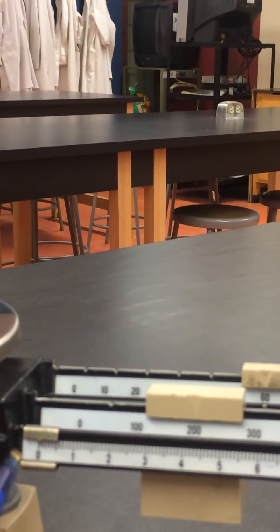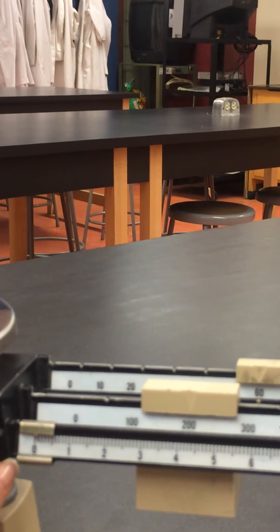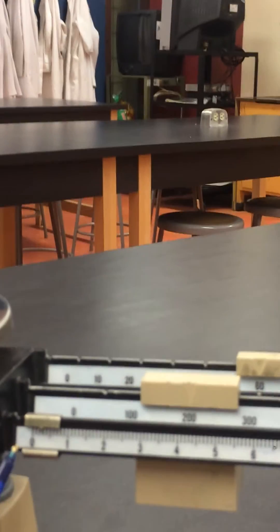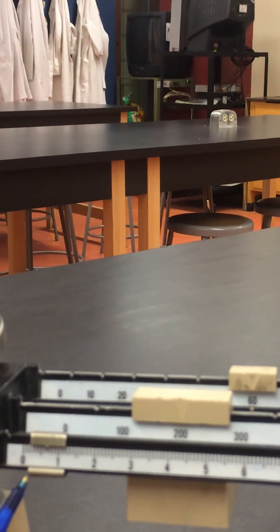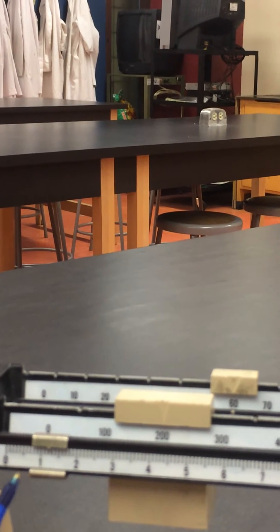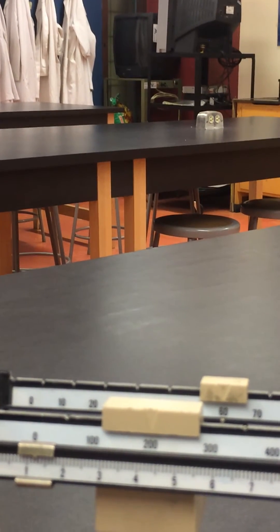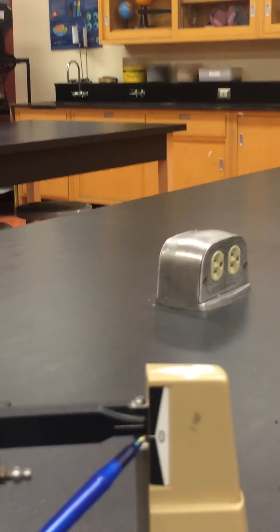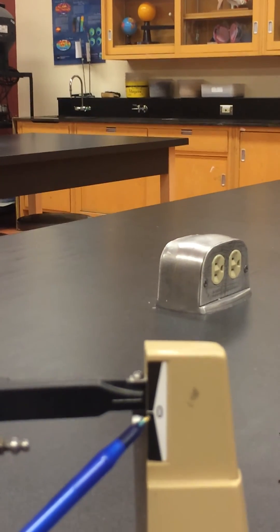Now we're going to find the units. So with a pen, or with the tip of your finger—I use a pen because it moves less—so you keep going. You see we're getting close to zero. This line has to approach zero.